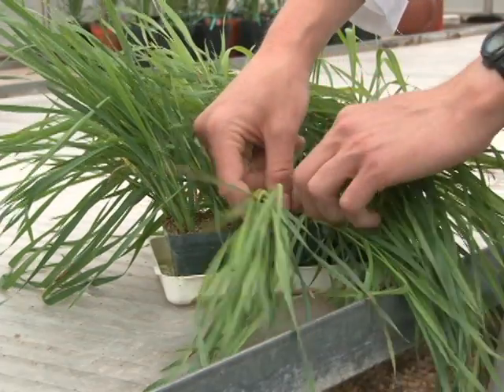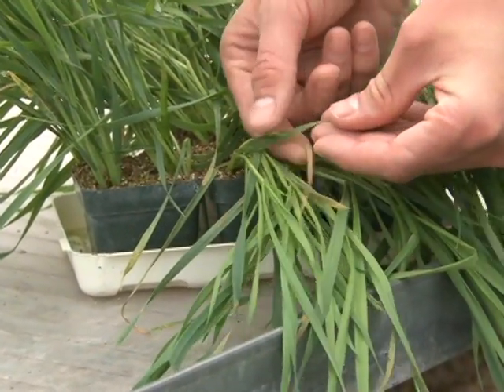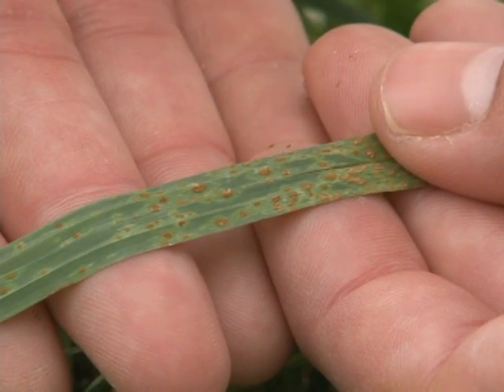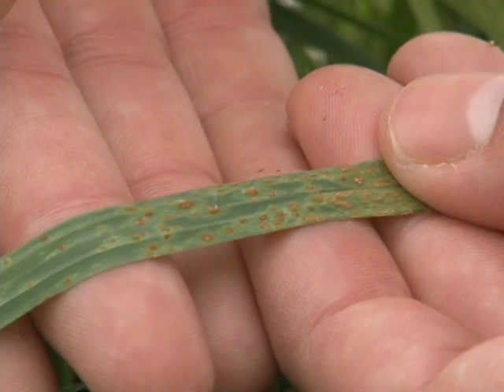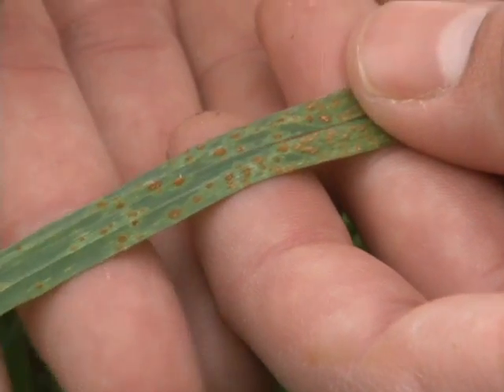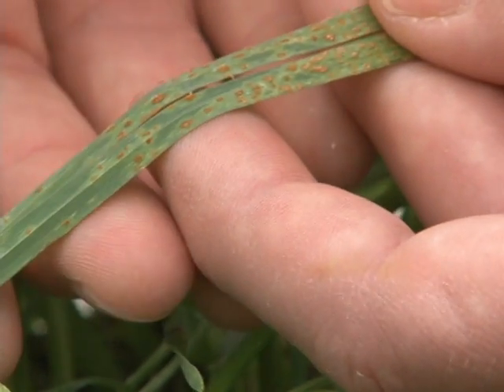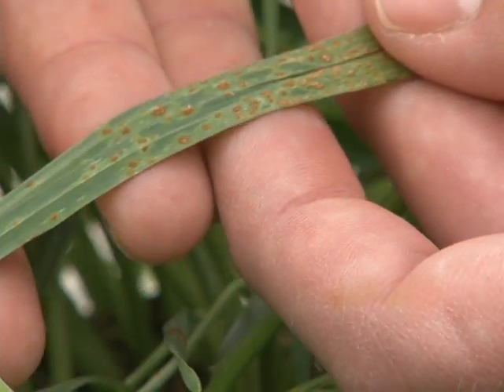As an example of an intermediate low infection type, I'd like to show this monogenic line with the stem rust resistance gene SR9A. You can see the reaction here is an intermediate reaction; however, we classify this infection type as low. We expect to see a 2-plus or even a 2-plus to 3-minus infection type exhibited by SR9A when inoculated with an avirulent race. This is significant because if you're not paying attention, you might misclassify this reaction as high. It's important to know the expected infection type for each resistance gene.